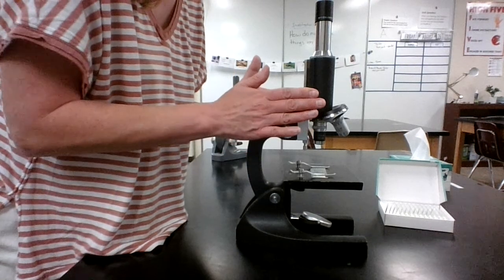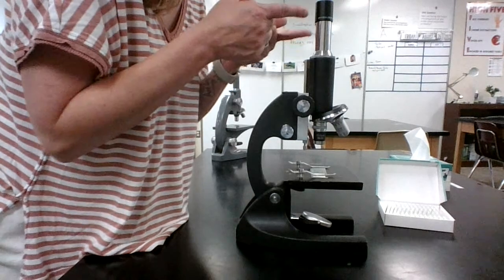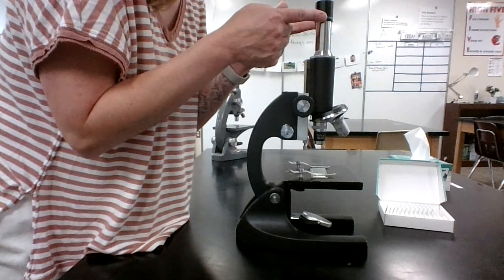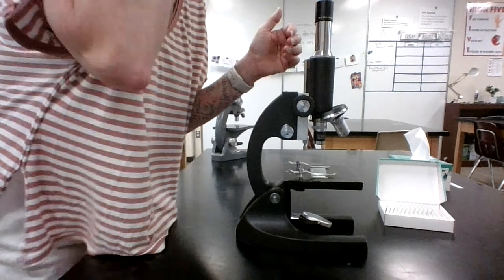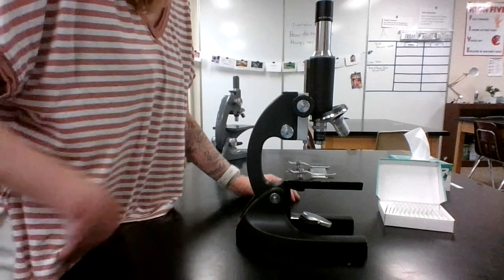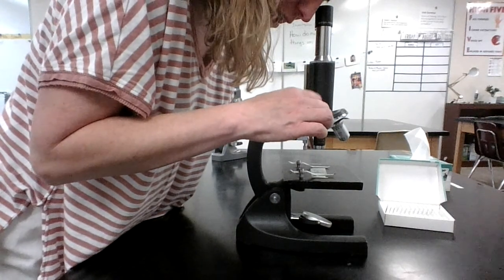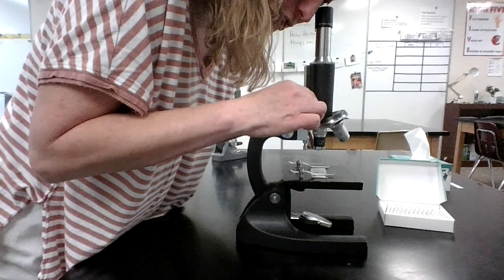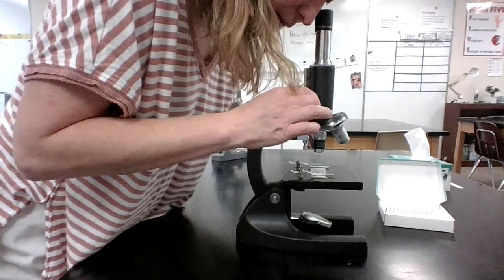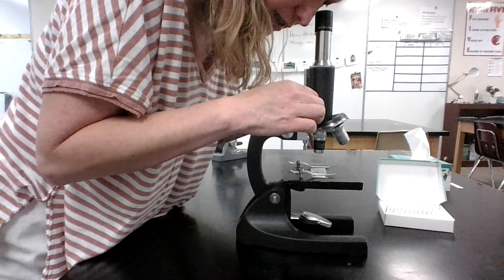I'm going to use my coarse adjustment. This is the big one. And I'm going to lower it looking through the lens, looking through the eyepiece until I say, whoa. Because if I'm like, maybe I'm seeing something, maybe I'm not, you're not seeing it. It'll be really obvious when you're seeing it. Sometimes I blink and I see my eyelashes. Sometimes I see little floaty things. Some of these microscopes, you'll notice what looks like a needle in there. That's just to help you find the center and to point things out.